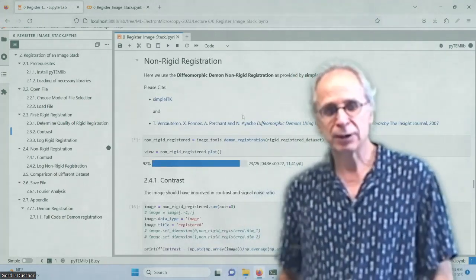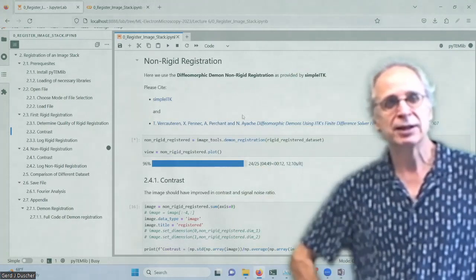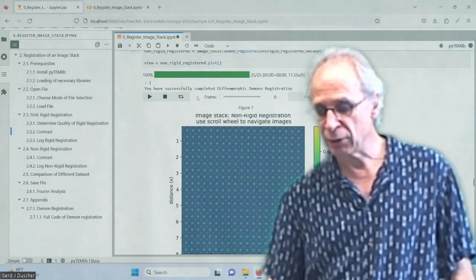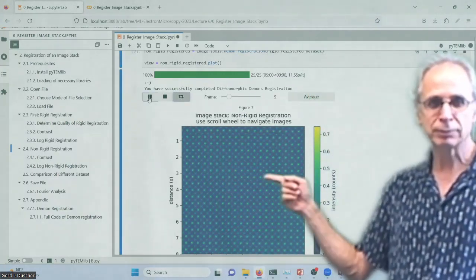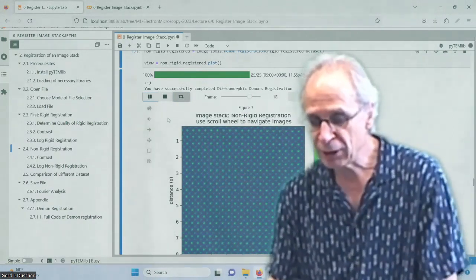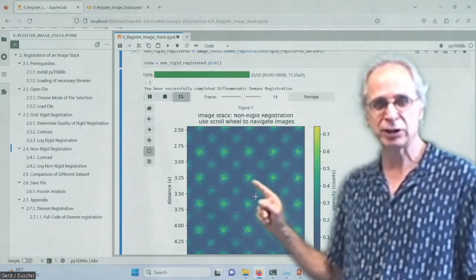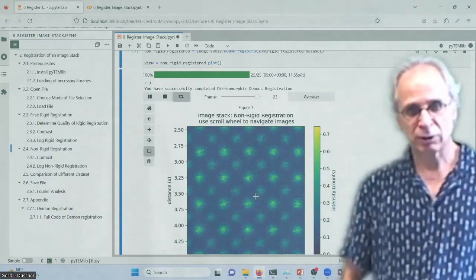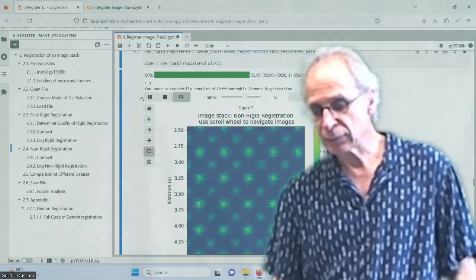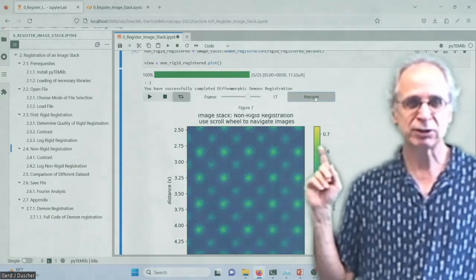We are still waiting here. The bar here tells us we need another 12 seconds. So once we have that, it plots it. And if we let that run now, you don't see anything, right? Okay, so it worked. If we zoom in here, let's see what happens. We have to zoom in quite a bit. Now we see that the only thing that is changing is the noise. And the atoms are, of course, very round. So everything is pushed back together. So we get a very high quality image if we average this kind of stack now. So this is as good as you can get it.